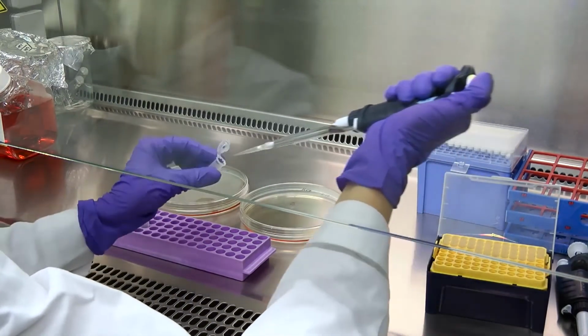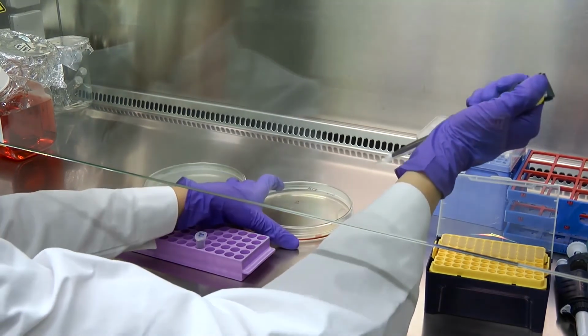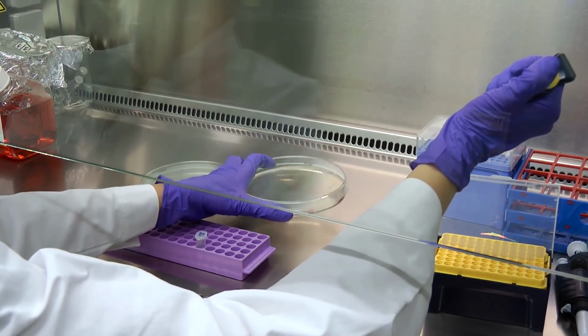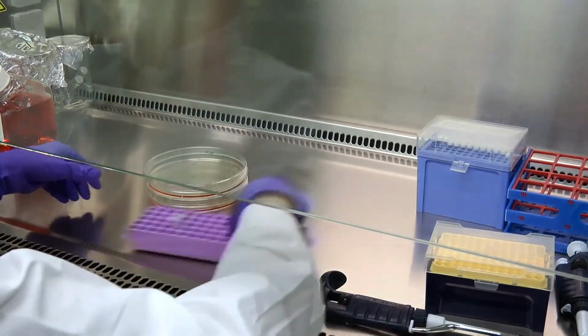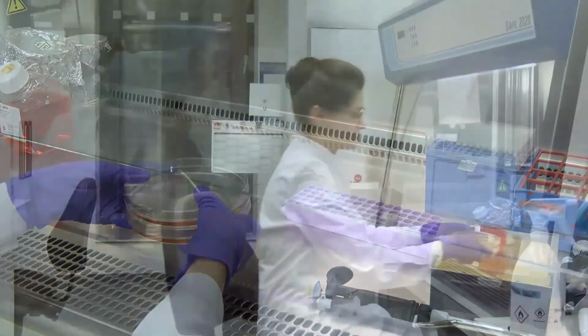And same with the other one. Now we'll leave the biology to do magic and put cells in the incubator where they feel warm and well cared for a few days, and then we see the results.